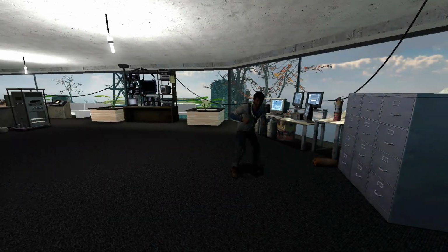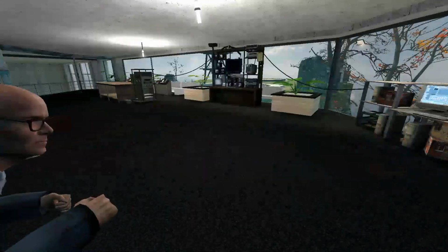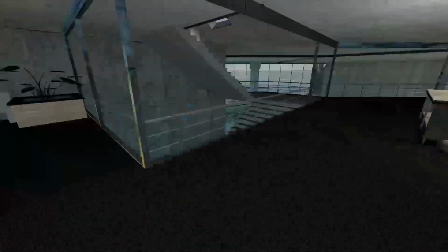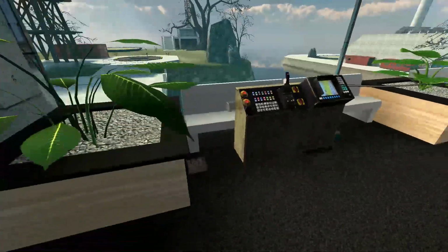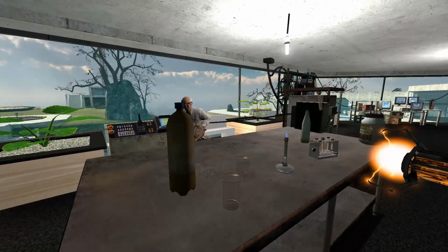Okay. First of all, you need to go and get medical attention. So go to the lobby and get yourself cleaned up. James, okay. We have to clean up this mess which you made. First, we need to deal with that broken glass. Pick it up. Now we can't use our hands for this. Yeah, go get a broom and start cleaning everything up. We're gonna try and give you a chance to redeem yourself.